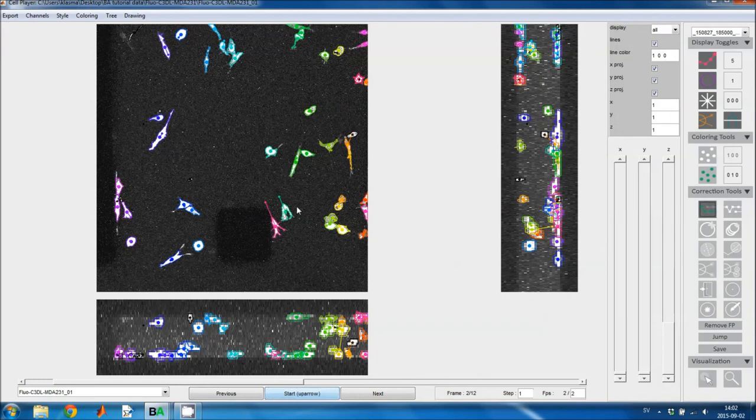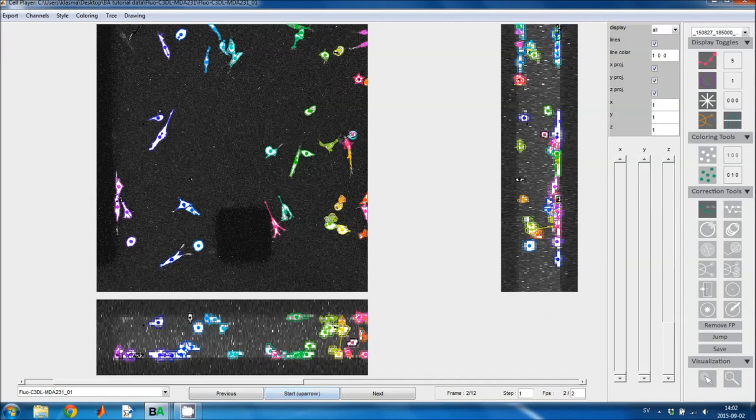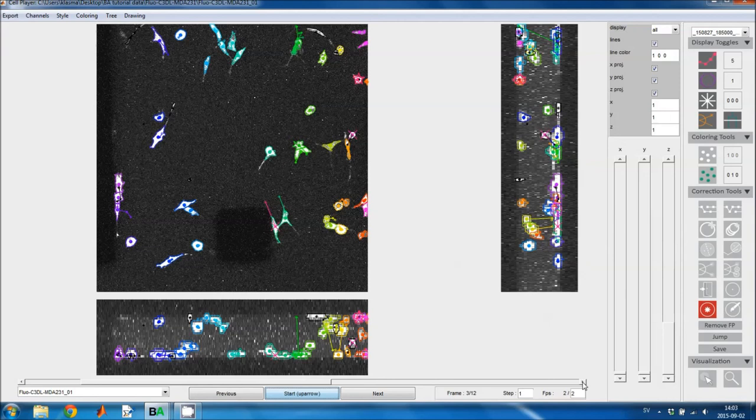And I think that this track linking here, this orange cell should have gone to this fragment and not there. So I'll delete it in the following images. Here is a track which was lost, and instead this became one single region. So I'll use the track split tool to fix that. I click on the center point in the previous image and then on the center point in the current image of the cell that I want to copy or split. And then I fix that track linking result.